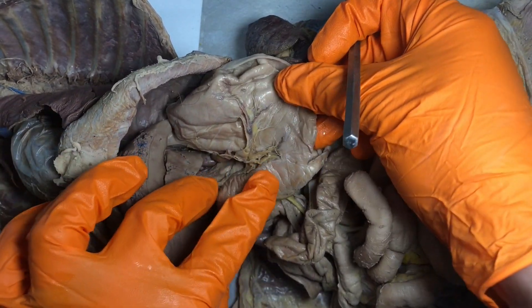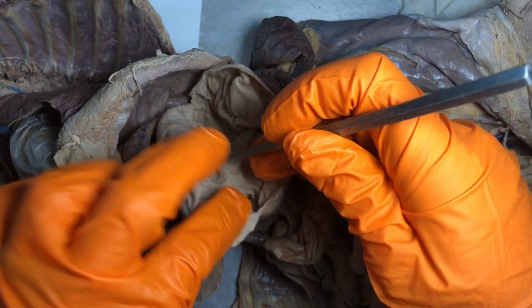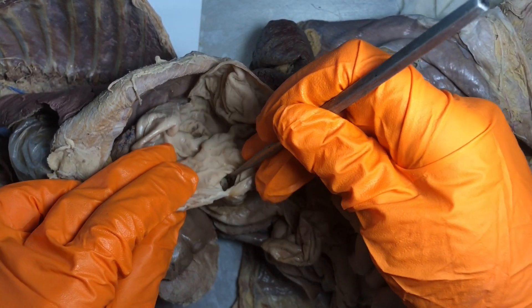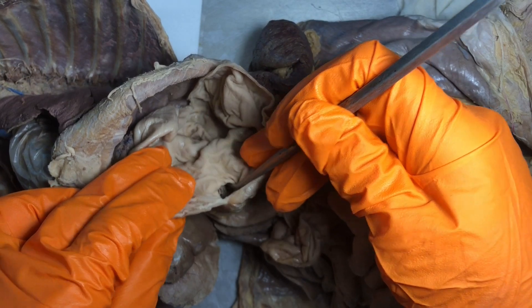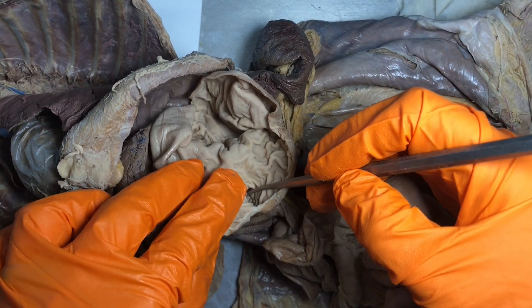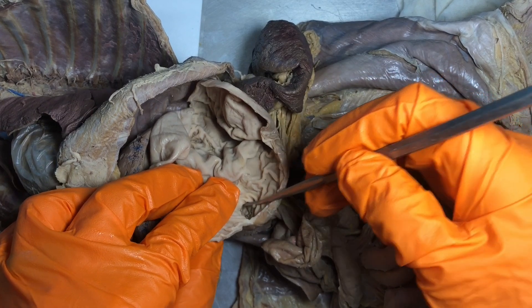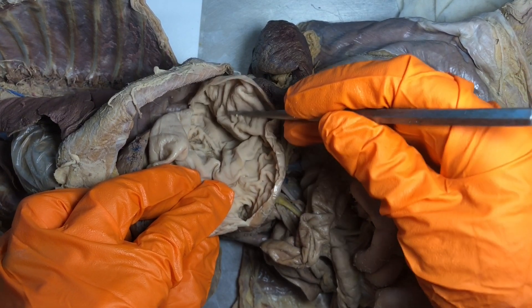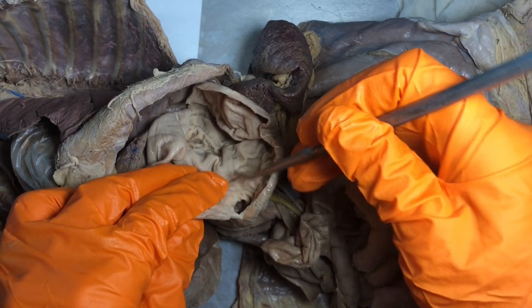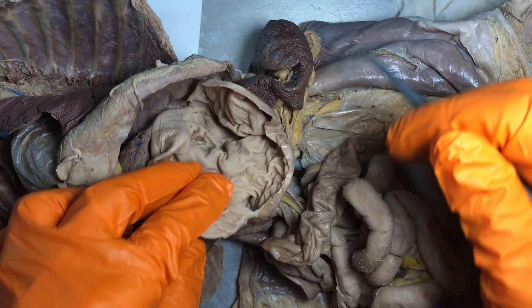Again we have the pylorus, and we have another sphincter there — this is the pyloric sphincter. The pyloric sphincter is really important because it's going to play a part in gastric motility and the passage of food from the stomach into that first part of the small intestine.